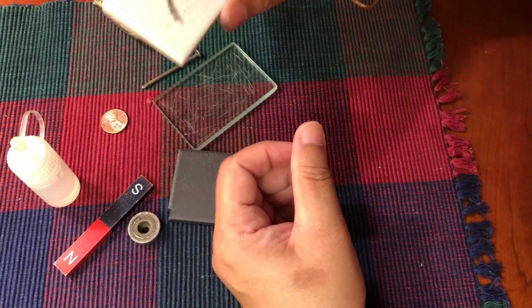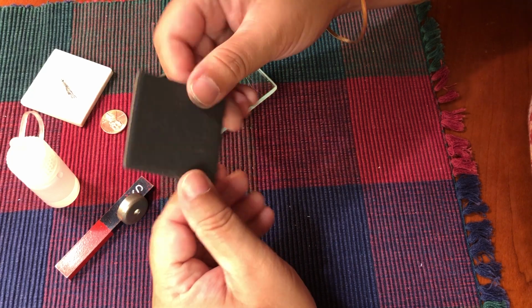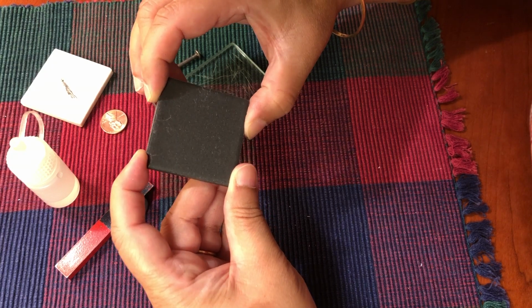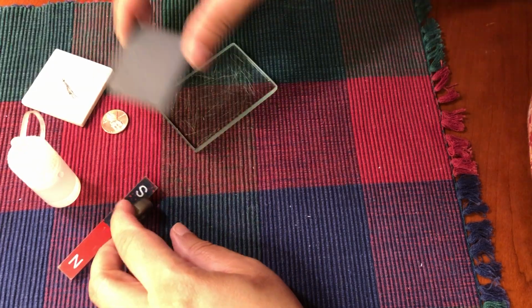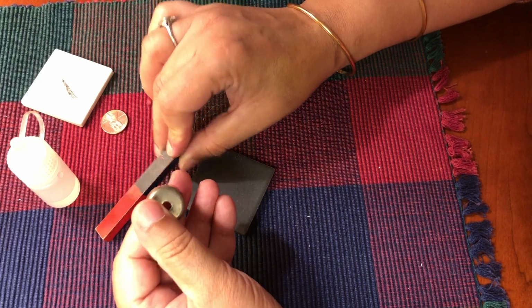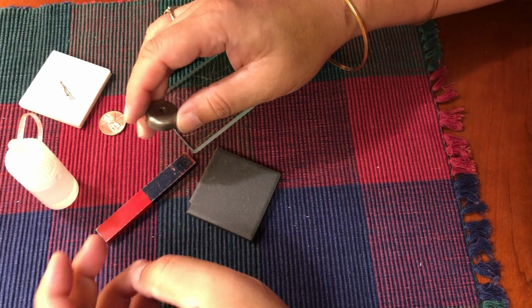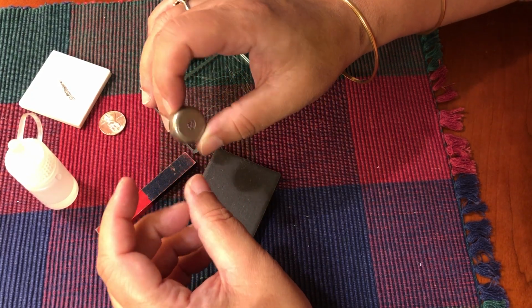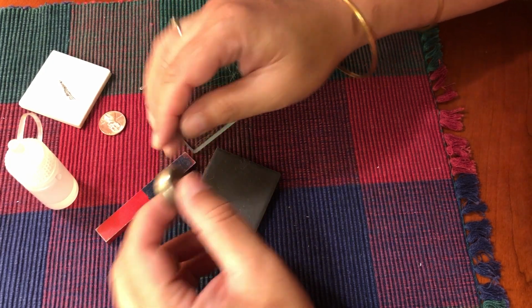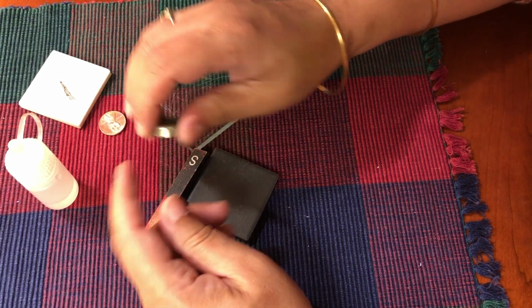So this is a streak plate. Now this is also a streak plate, which for minerals that produce light colored streaks, we use a black streak plate. Now you also have magnets here. There's one mineral in your group of minerals that is magnetic, and you can test it to see if it gets attracted to a magnet. So these are magnets, this and this, and that mineral can be tested by using a magnet.